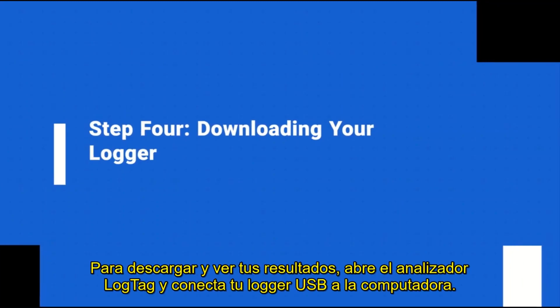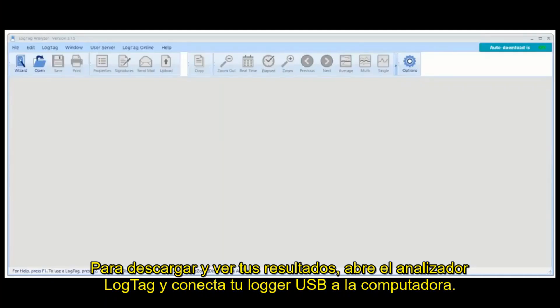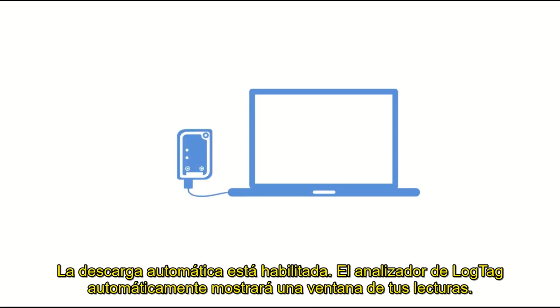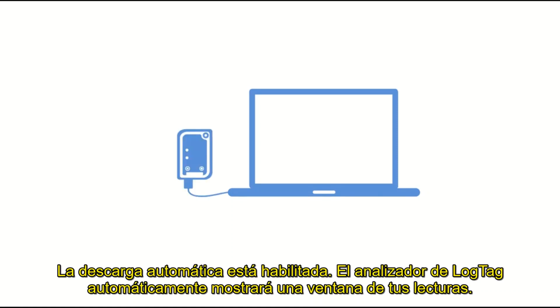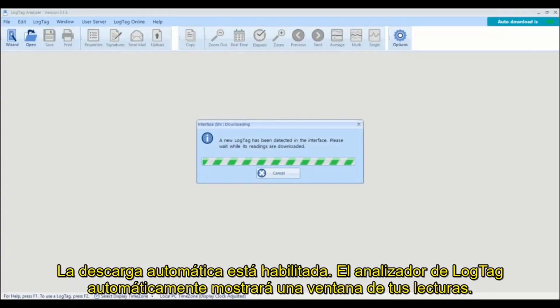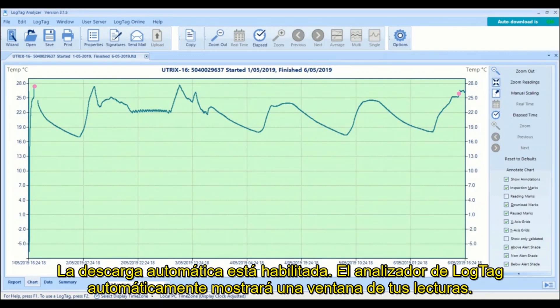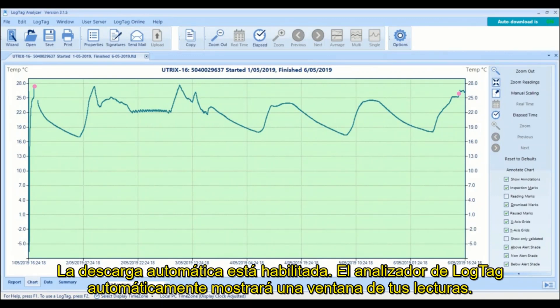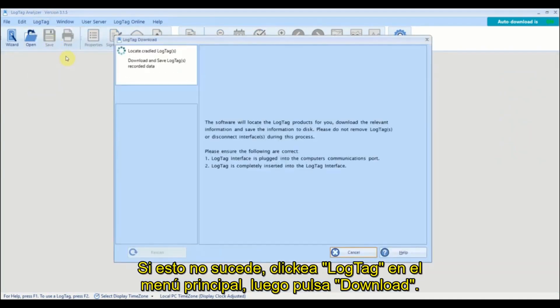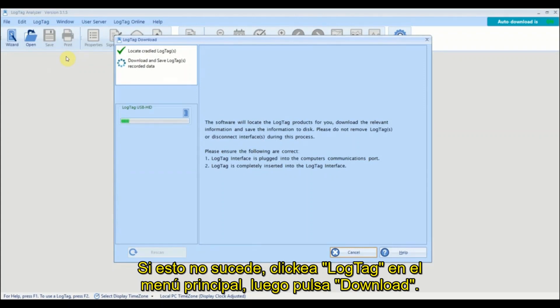To download and view your results, open LogTag Analyzer then connect your USB logger to your computer. If auto download is enabled, LogTag Analyzer will automatically display a chart of your readings. If not, click LogTag from the main menu then click Download.